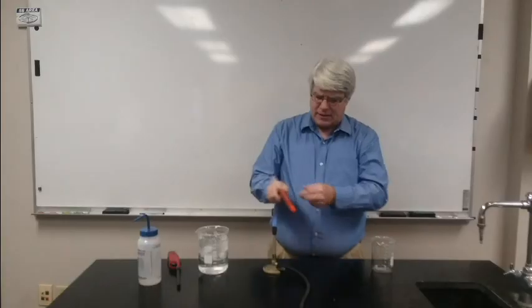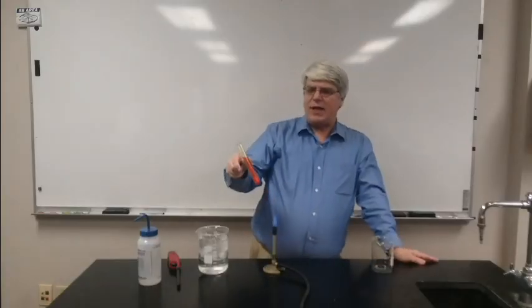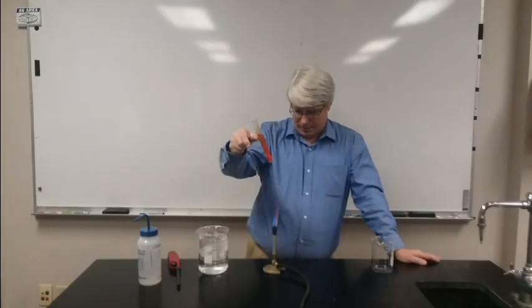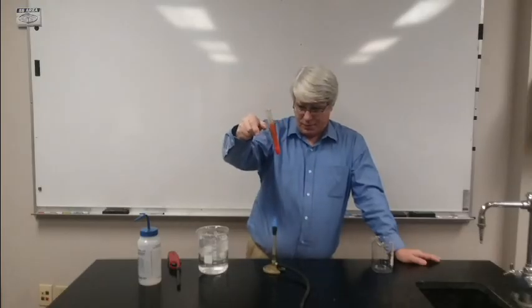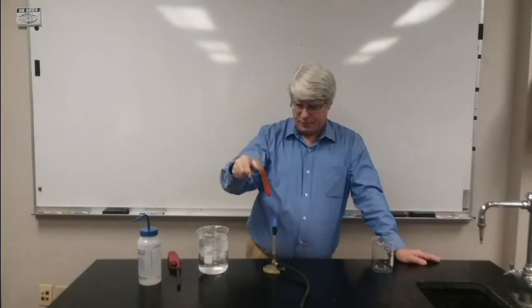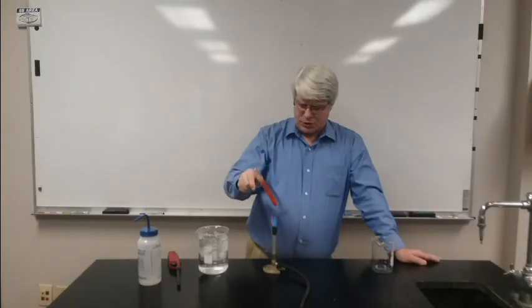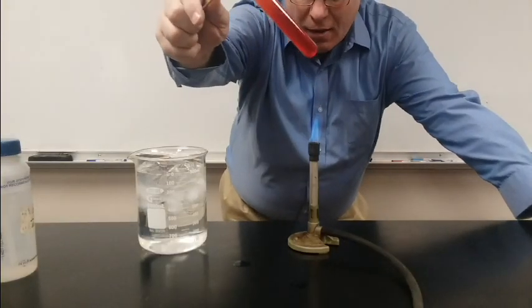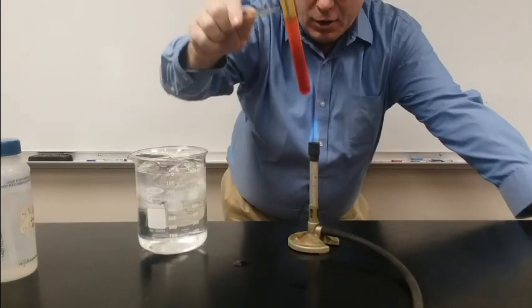As I heat this solution, that's going to increase the solubility of the solid. You can already see that more of it's dissolving. It's kind of hard to heat it in a test tube. I cut out a bunch of that video, but you can see now there's no solid in solution — it's all dissolved. There's no solid there at all.